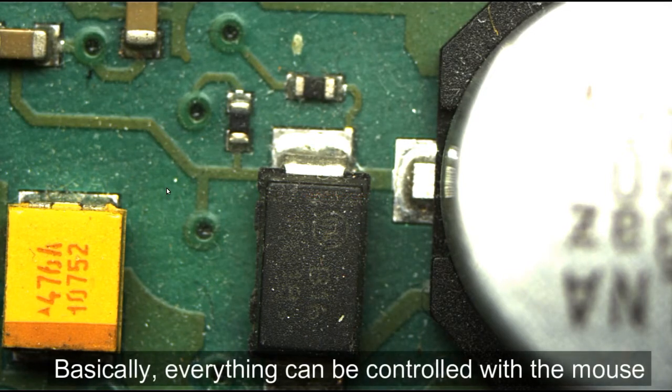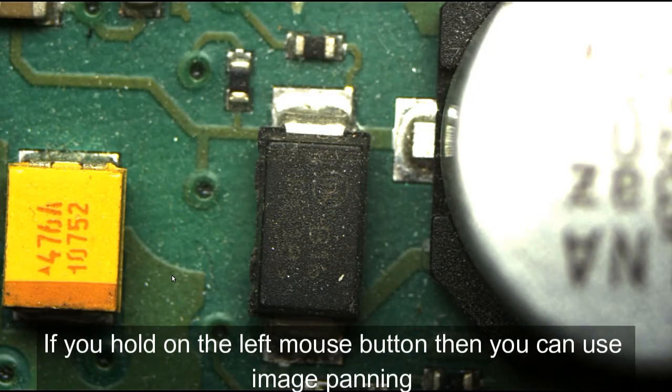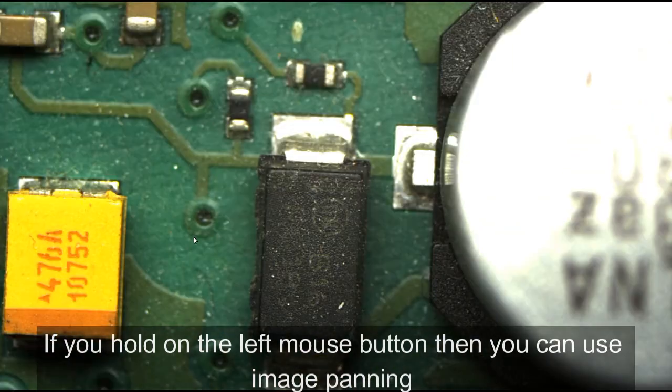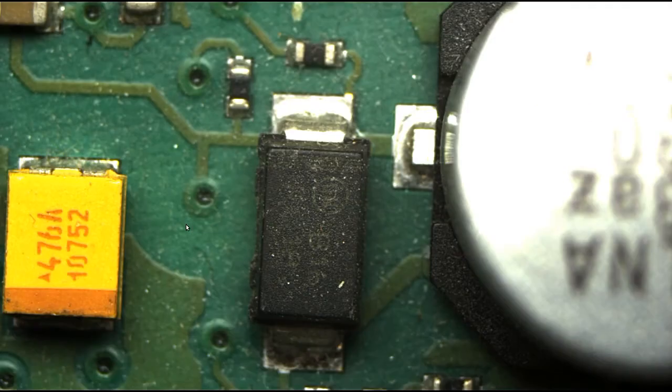Everything can be controlled with a mouse. The sensor of the camera sees a bigger area than what you see on the screen. You can move the visible area on the screen. Keep the left mouse button pushed and move your mouse to move the image. That is called image panning.